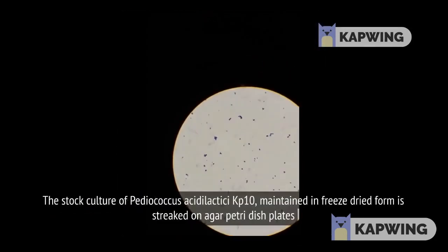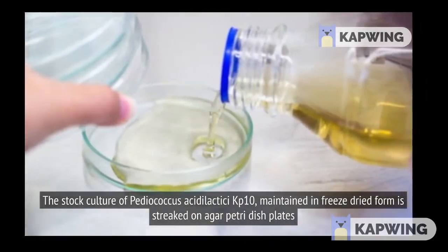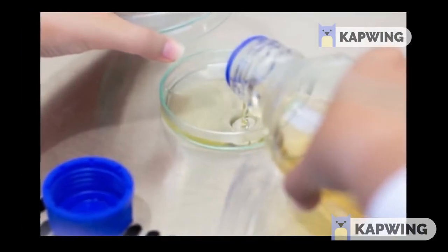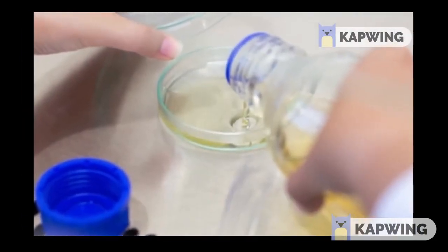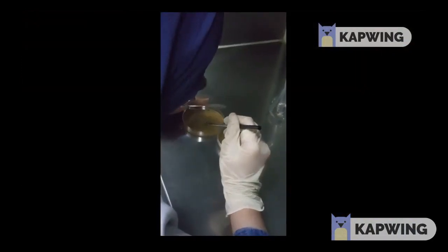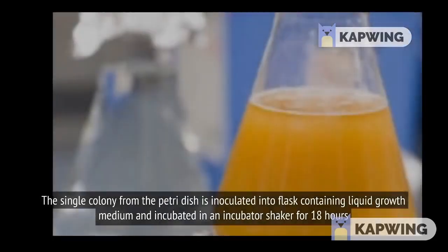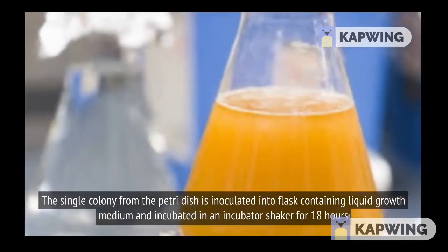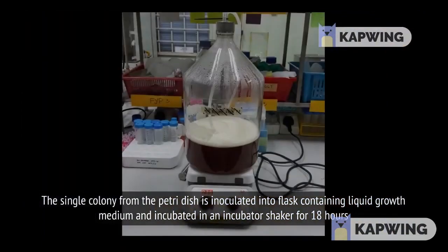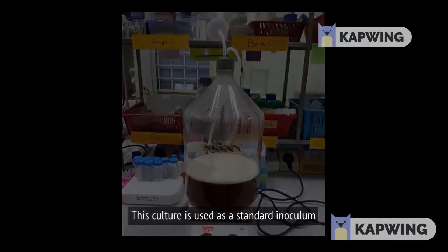The stock culture of Pediococcus acidilactici Kp10, maintained in freeze-dried form, is streaked on agar Petri dish plates. The single colony from the Petri dish is inoculated into flasks containing liquid growth medium and incubated in an incubator shaker for 18 hours. This culture is used as a standard inoculum.